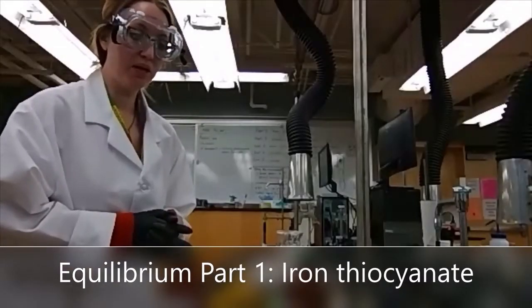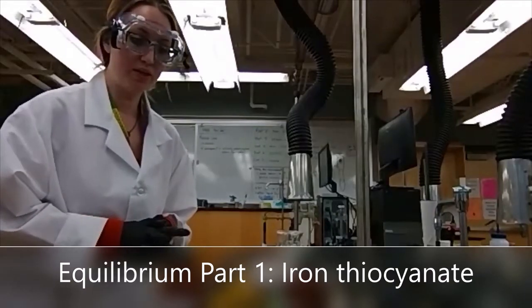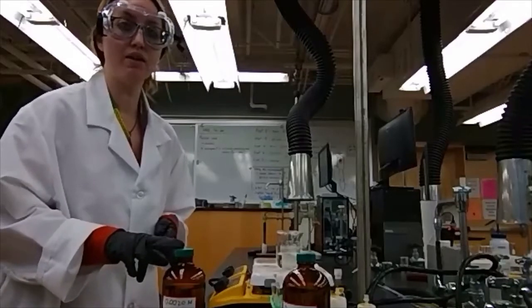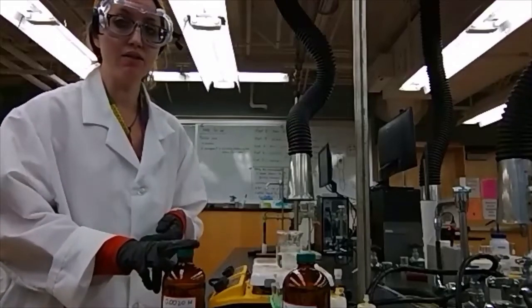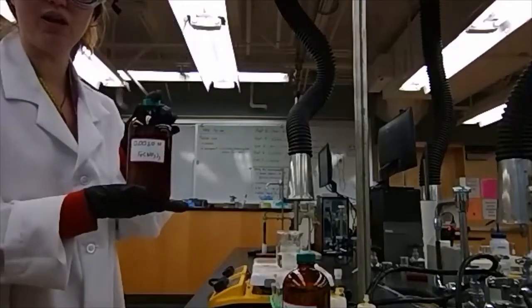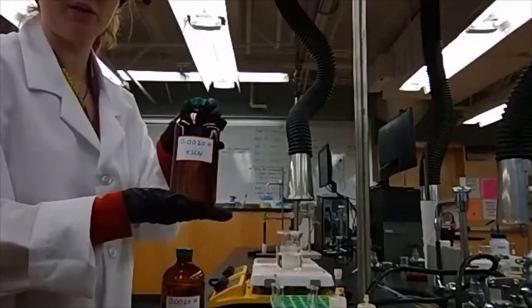With this part of our equilibrium experiment, we are going to be looking at the equilibrium system involving iron thiocyanate, a red complex. Now we make the iron thiocyanate stock solution by mixing a solution of iron(III) nitrate and potassium thiocyanate.